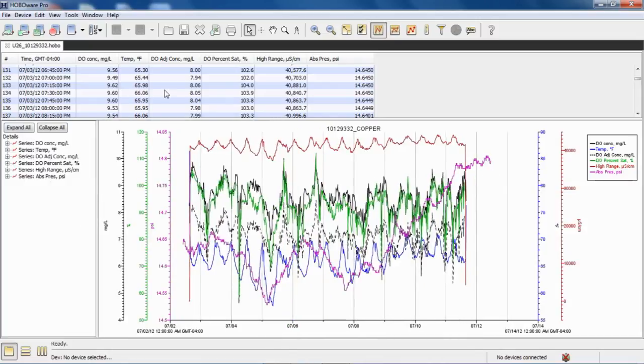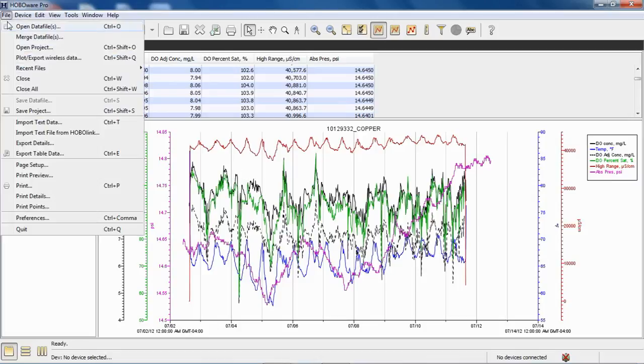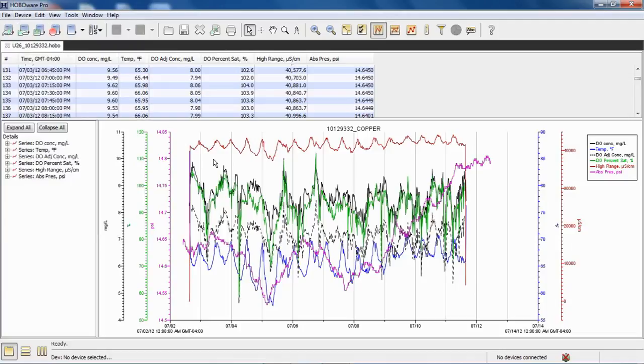Once we are happy with how this is plotted, we can save it as a project file. If we don't save it as a project file, the next time we open the .hobo file, the U26 raw data file, none of these parameters, these calculated parameters, will be retained. We have to save that as a project file in order to retain them. So we click on File and Save Project. If we want to export it to Excel, we click on Export Table Data, and the data is exported in the format that we set in our HOBOware preferences.